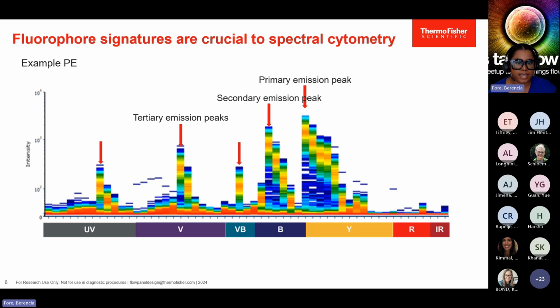So here we have PE. It has its primary emission peak in the yellow laser, a secondary emission peak in the blue, and it also has tertiary emission peaks in the violet and UV lasers. For instance, if you're experiencing issues with your blue laser, you'll notice that the secondary emission peak for PE is missing, and it'll offer some indication that something's off.